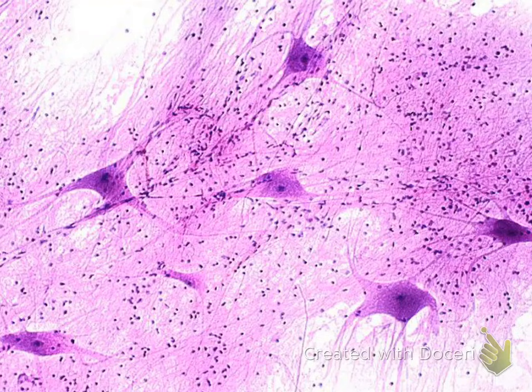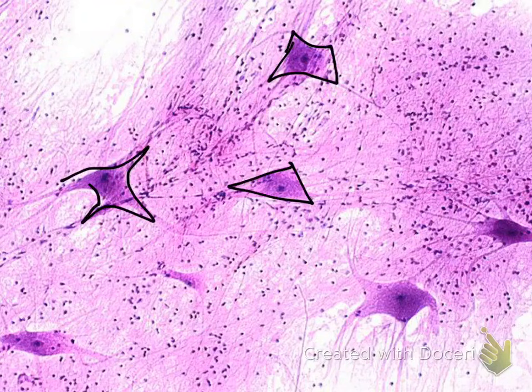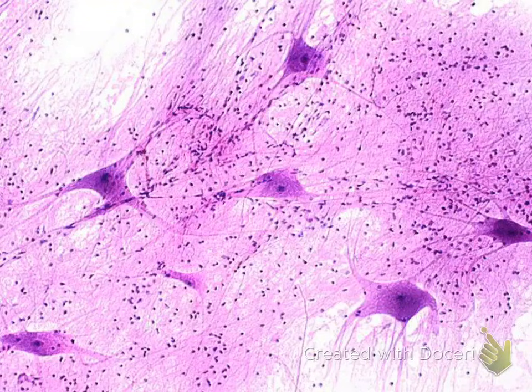The first thing you'll notice about this tissue is these triangular shaped or a star shaped type of cells. Whenever you see these type of cells, you know you are looking at nerve tissue. All of these tiny black dots that you see everywhere, these are your neuroglial cells, which are the supporting cells for the neuron. The parts of the neuron you need to know is the cell body, which is this main portion.